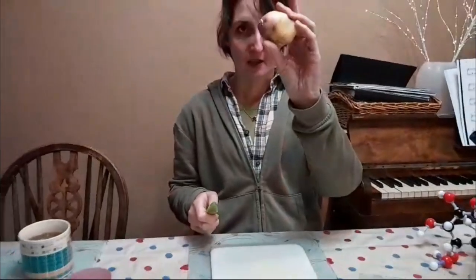I've got a potato. We're going to use a potato. And there's 3 key words you need to know. And these are hypertonic, isotonic, hypotonic. Now, if something is hypertonic, when we think of hyper, we might think of hyperactive, which is where you've got lots and lots of energy, lots of movement. I know that there's a lot more to it than that, but when we think of hyperactive, we think of what we can see, which is lots of energy.